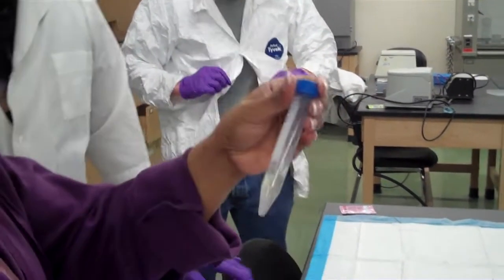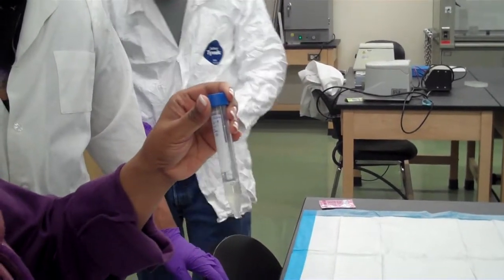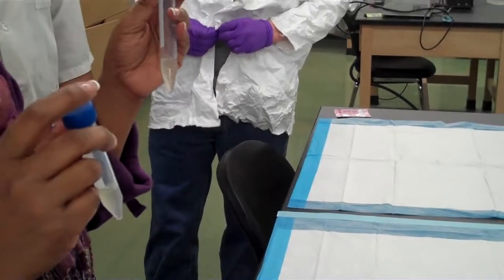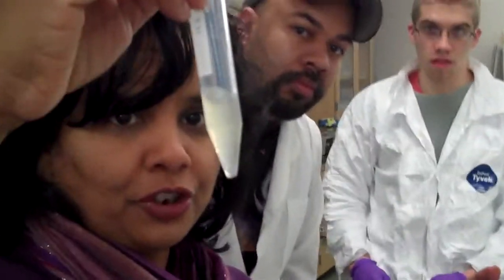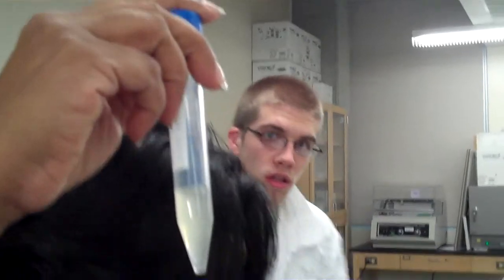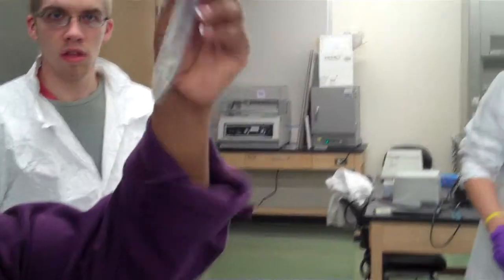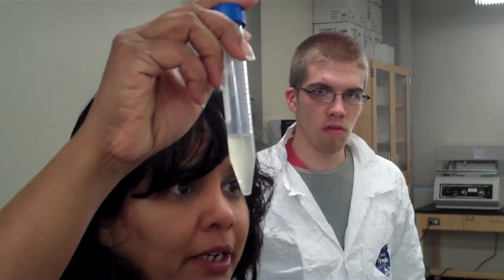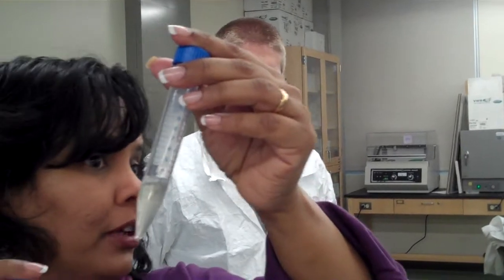So what you want to look for is what is called turbidity. Do you remember what this looked like yesterday? It's completely clear, right? And look at what it looks like today. And you shake it. You want to shake it hard, and you'll see if you hold it against the light that it's turbid. Okay, the more turbid it is, the better. If your tube looks like this, it's ready. If your tube looks like this, it could go for a little bit longer.